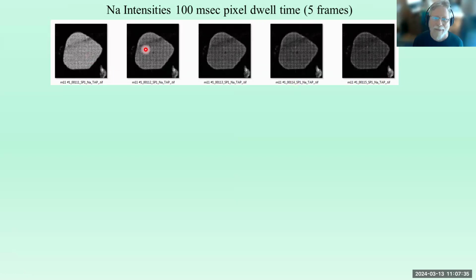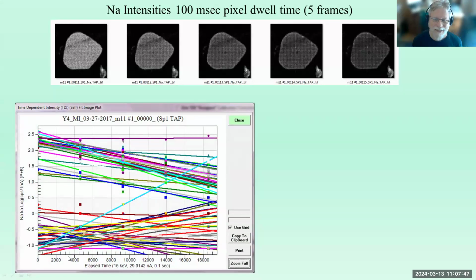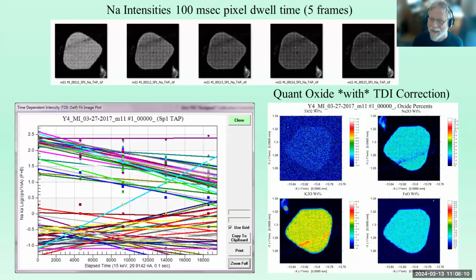This is each replicate map. We did 5 replicate maps. You see the sodium intensity is dropping as the TDI effect kicks in, because interestingly enough, as this may seem unbelievable, this is a map here. We're talking about 18,000 seconds here. And the pixels down here at the bottom are the quartz, so they're not really changing, that's just noise. But the ones up here are the sodium signal, and the slope varies depending on where it is in this melt inclusion. And when we quantify it, though, we get a perfect correction.